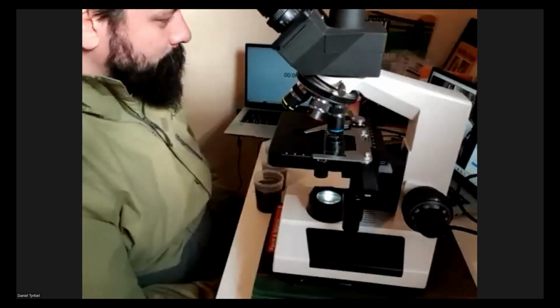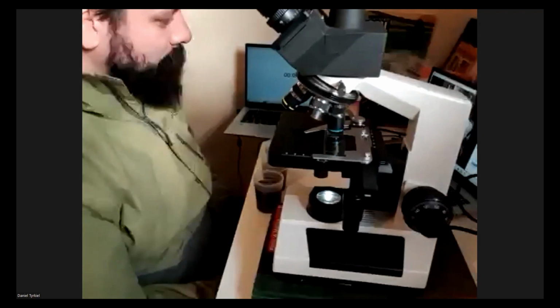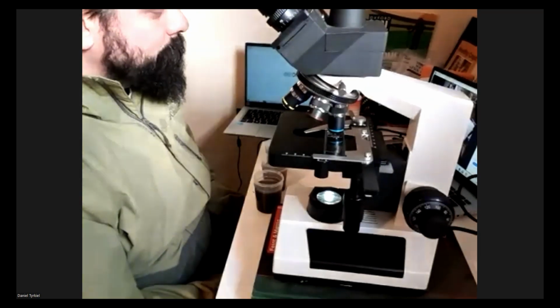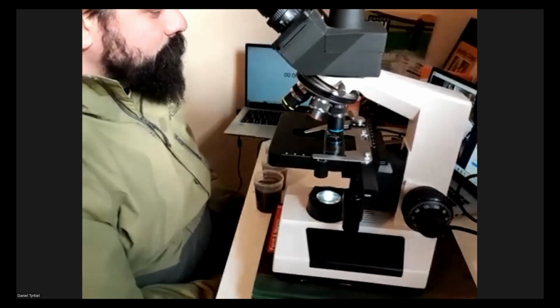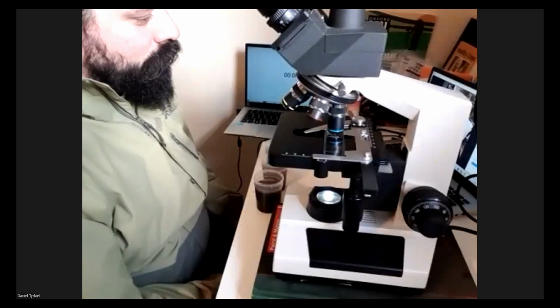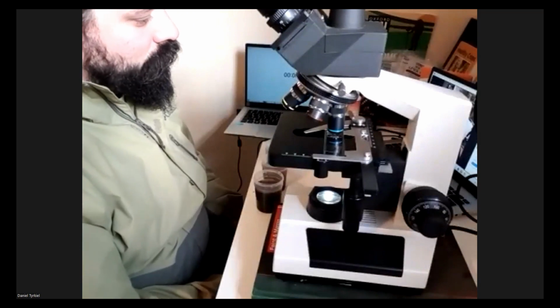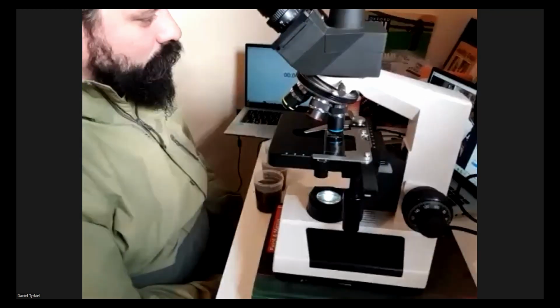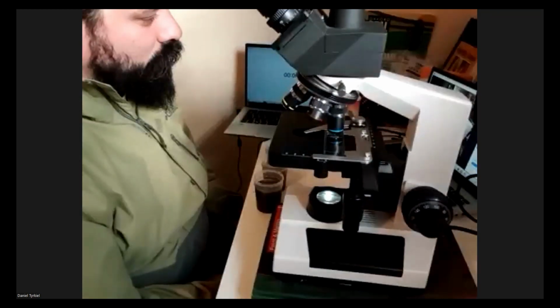It gives you the tool to record your observations, and the spreadsheet that I was showing you briefly also gives you a reference to remind you of what to look for and how the process is to be done, so you don't have to worry that you've forgotten what you're looking for, like nematode parts. You can have that morphology reference all in one place, and this is something I wish I had when I was first starting out.